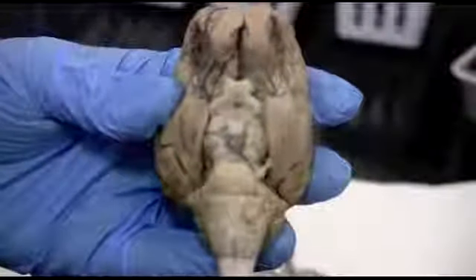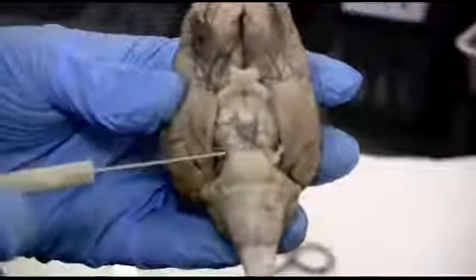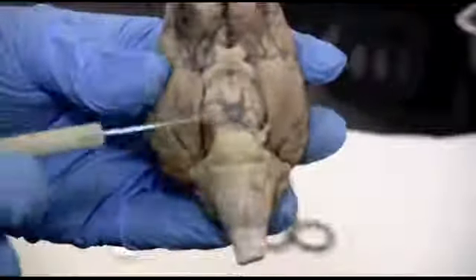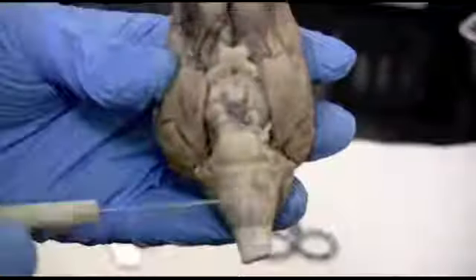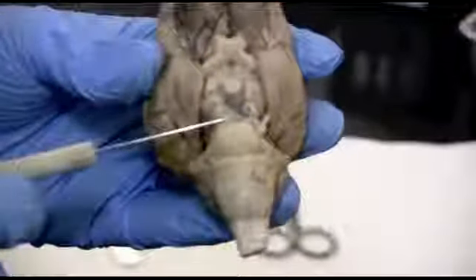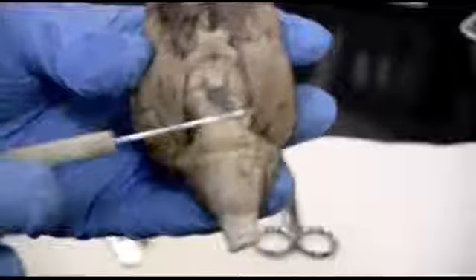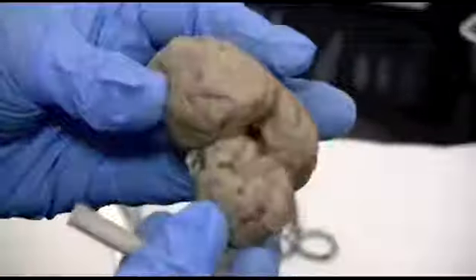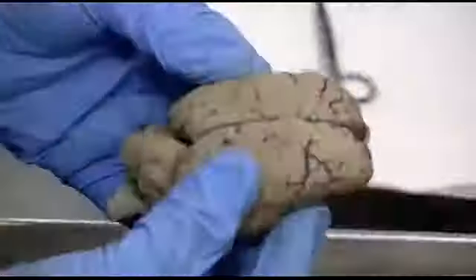Okay, and on the inferior side, the midbrain, just above the pons, you've got these cerebral peduncles. It's hard to see them the way that you would in a picture, but it's just these regions just above the pons in the middle, corresponding with those colliculi in the back.